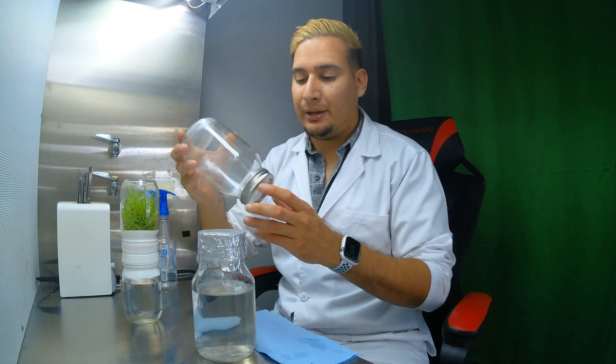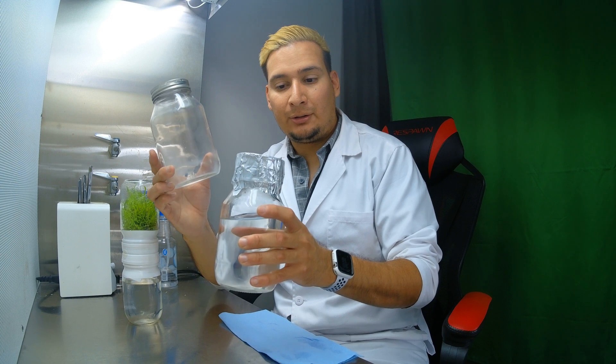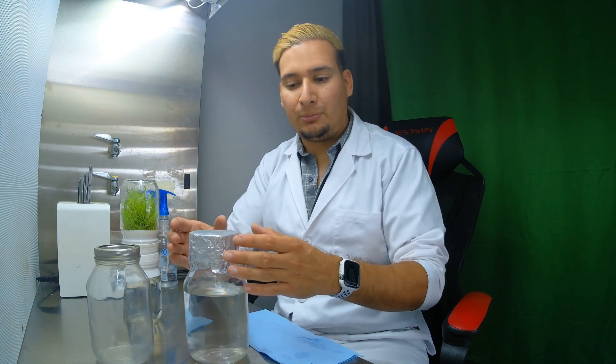So I already sterilized the jar and sterilized the media with the biocoupler, and then I just put this piece of aluminum foil on top so it's still sterile. So what I'm going to do now is I'm going to transfer this into this new biocoupler.